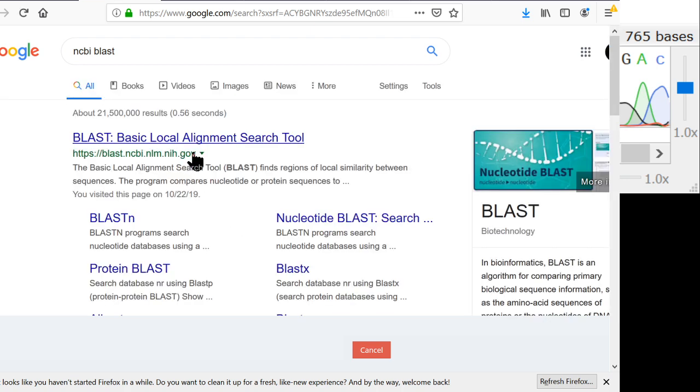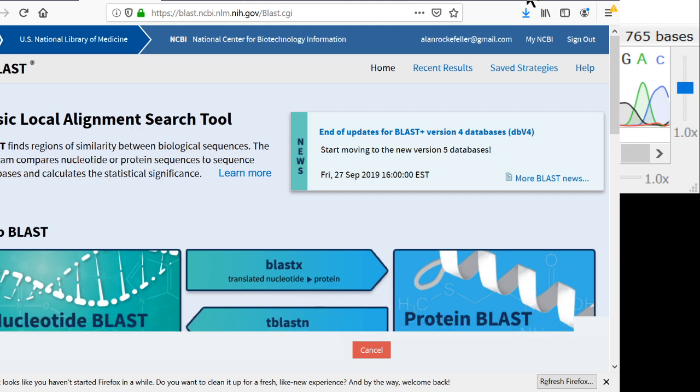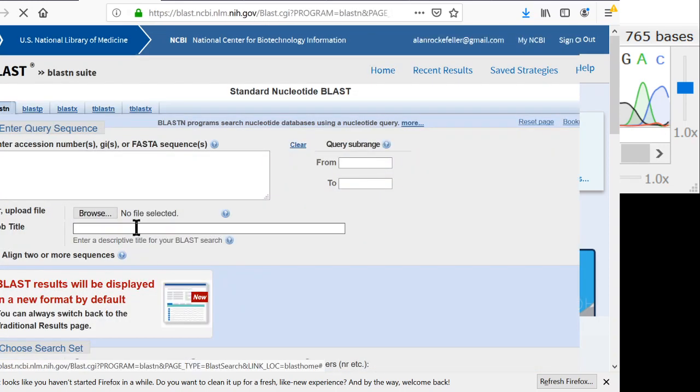So NCBI BLAST. BLAST is called the Basic Local Alignment Search Tool. What this does is it's a way to search all of the sequences that are in GenBank, and it does that using an algorithm called BLAST. We input a query sequence in here, and it compares this query sequence with every other sequence that's ever been uploaded to GenBank.